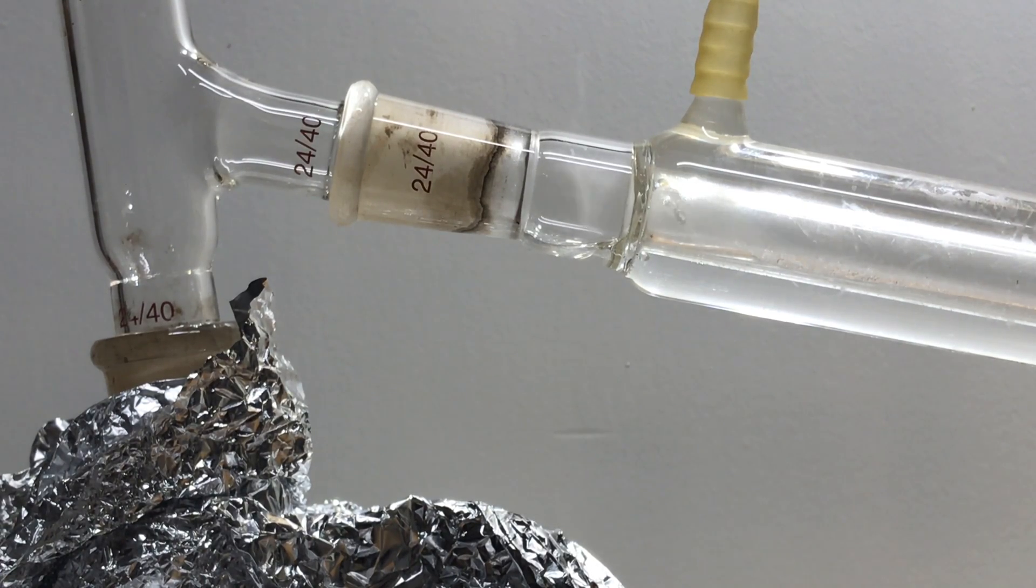Finally, when I reached the temperature again, you can see that white smoke passed through the column and condensed immediately afterwards.